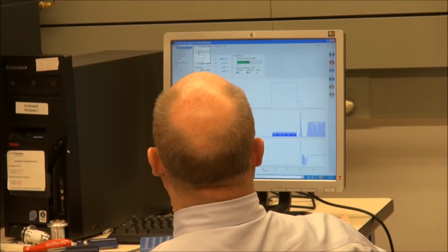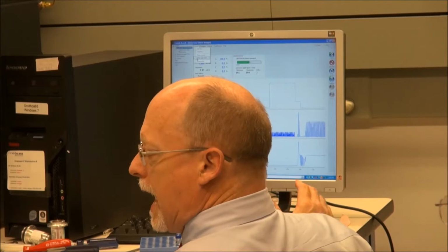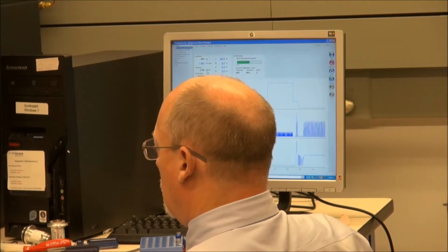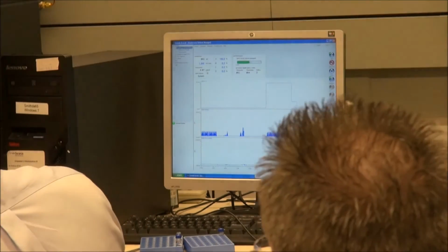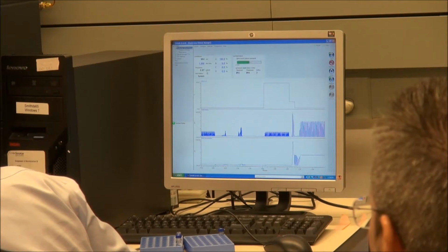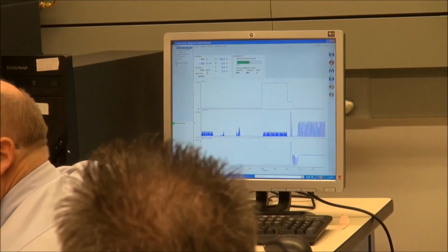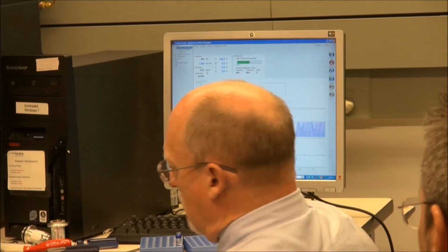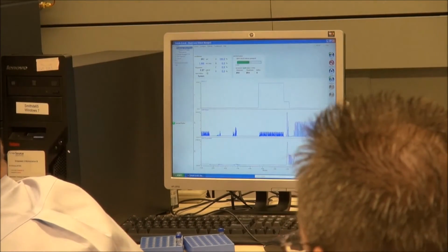Okay, so I've got prime solvents, stop flow, set flow, prime seal wash. Okay, this is interesting. Now, I told you I was going to teach you how to listen for things. So if I prime seal wash, I want to listen to see if I have one click or two. If I have 2 clicks, then I'm not primed. As soon as the fluid comes through, and we can see the fluid come to here, as soon as fluid gets down into the seal wash pump, the second click will be attenuated and will just be cheep, cheep, cheep. What does this option do? It's priming the seal wash, which is just going back through the back of the pump.